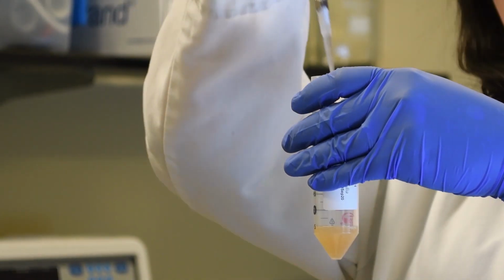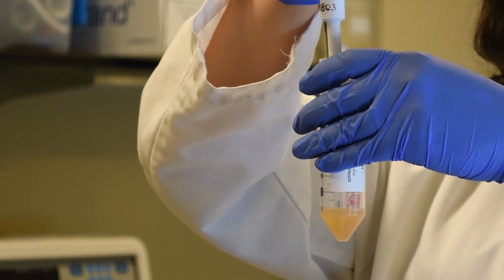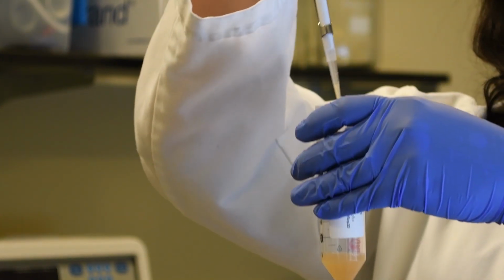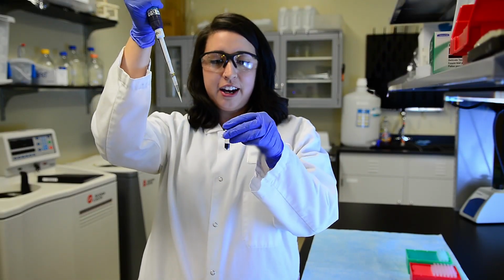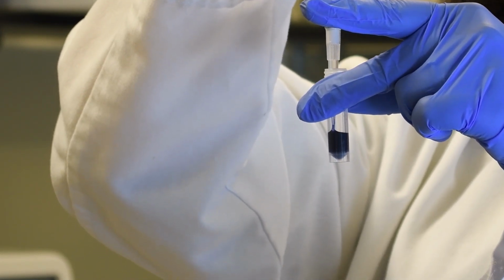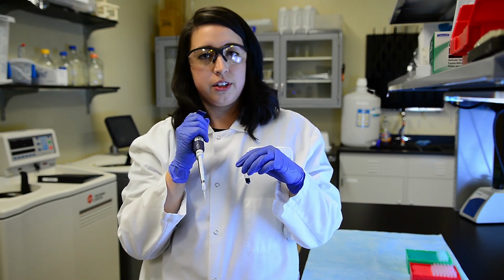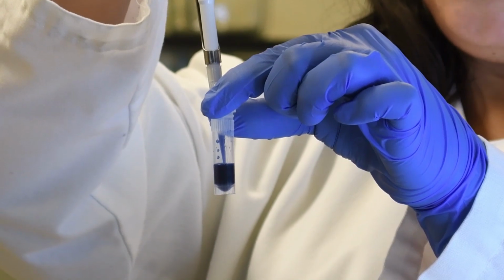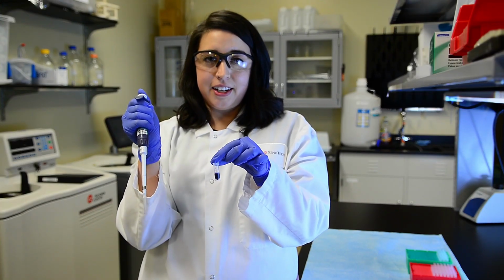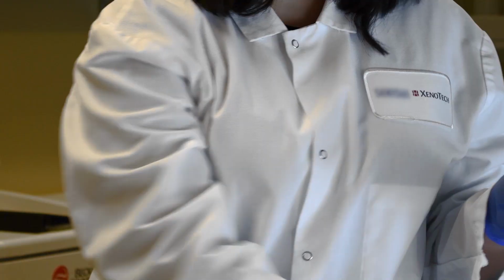When training, I always suggest bringing your pipette tip all the way down to the bottom of the tube and bringing it up slightly to take your sample from around the middle. When adding your cell suspension to your counting solution, the pipette tip should barely touch the top of your surface. This is so that cells on the outside of the tip are not included in your cell count. Do not pipette up and down to mix your sample, as this can shear your hepatocytes and can lower your viability. Instead, gently rock your sample back and forth to mix your sample before adding it to the hemocytometer.